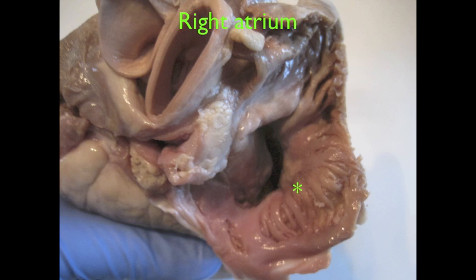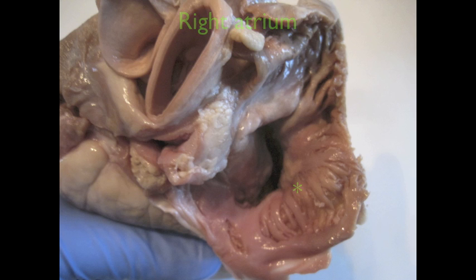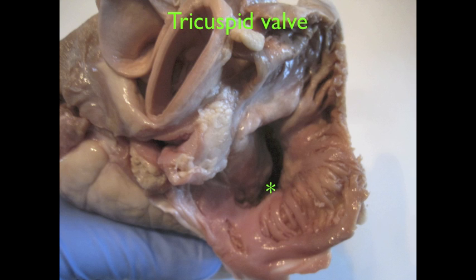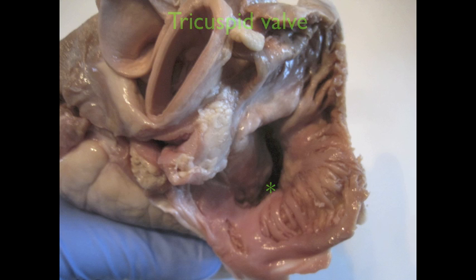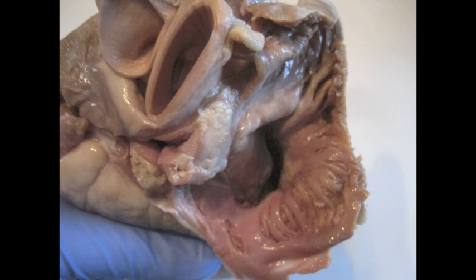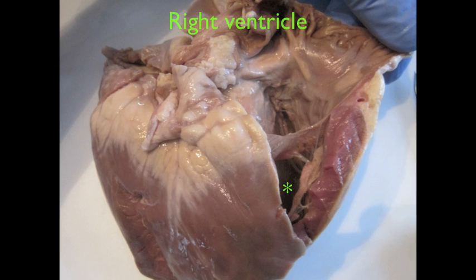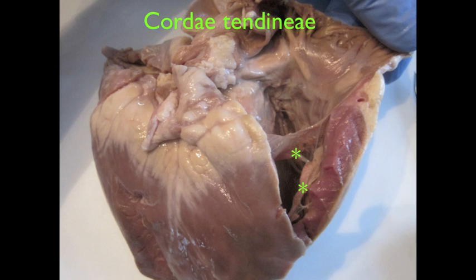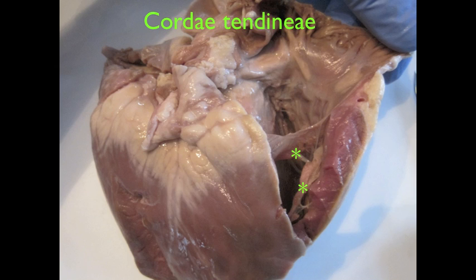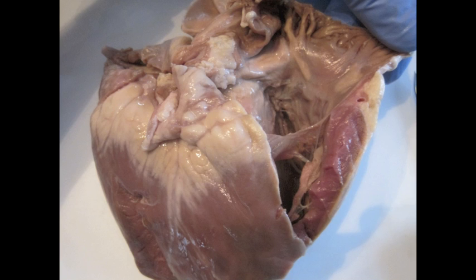In this image, the right atrium has been cut open. You can see the tricuspid valve shown here, which is the valve that lies between the right atrium and the right ventricle. In this image, I've cut down farther into the right ventricle. Again, you can see the tricuspid valve, as well as the cord-like tendons called the chordae tendinae that extend from the valve into the right ventricle. These tendons prevent the valve from prolapsing back into the right atrium and prevent the regurgitation of blood back into the right atrium.